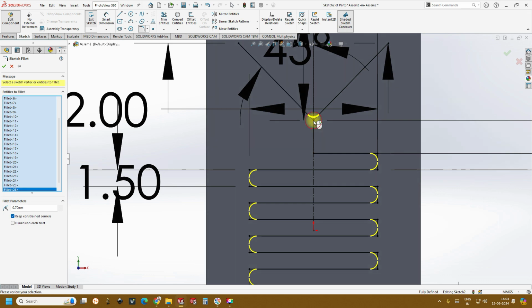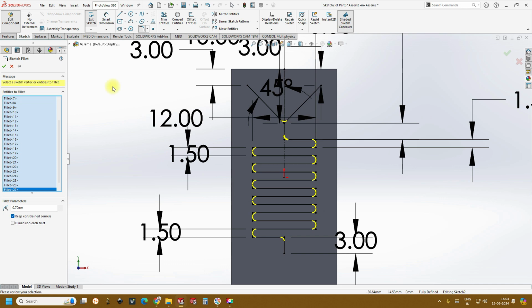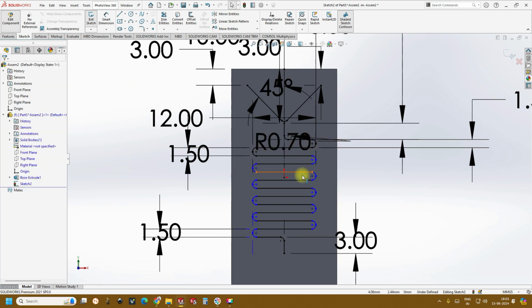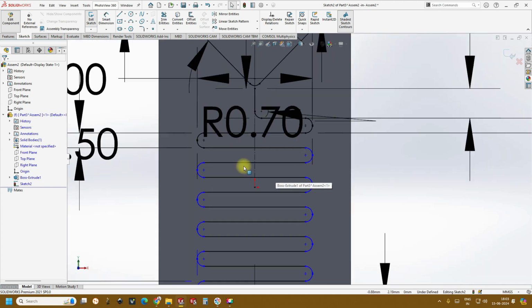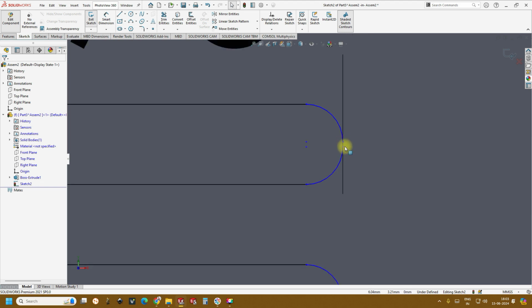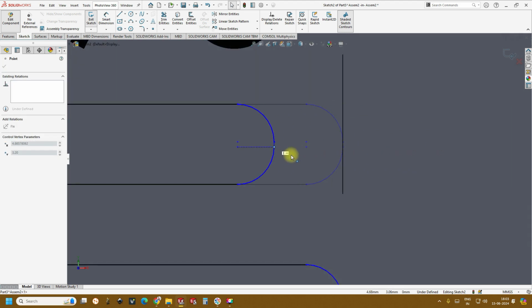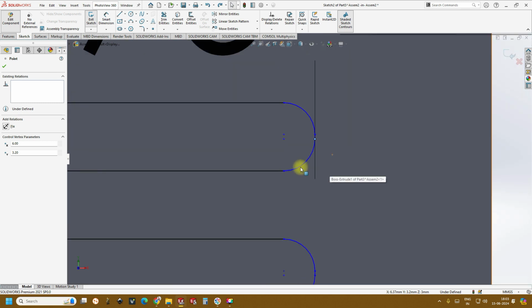Okay, you can create it here as well as here and click OK. Boom. And now if you see, it has changed into blue. Okay, do not worry. If you see, it has been moving in the x direction. So click Control Z. And then simple, we just need to give a collinear relation.